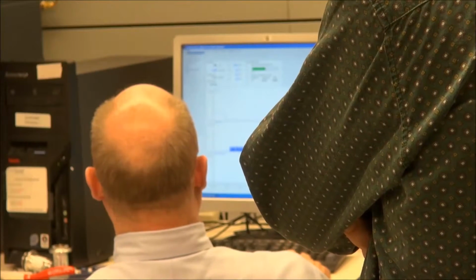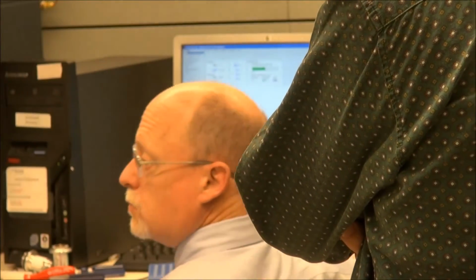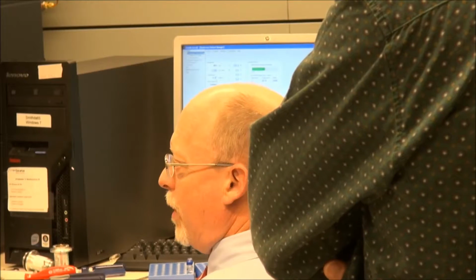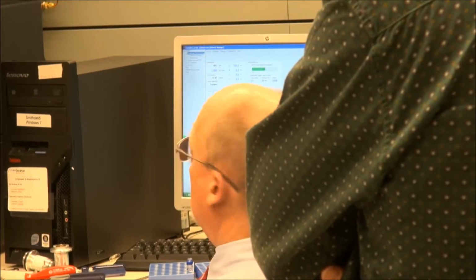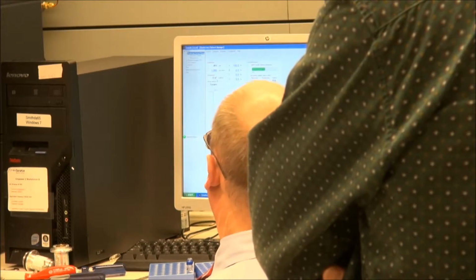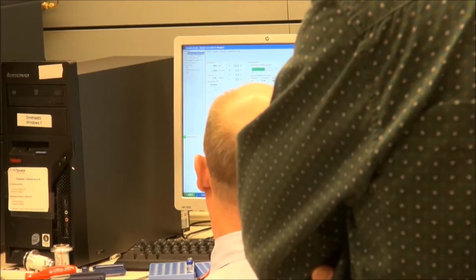So my degasser's at 0.86. It's reasonable. I expect my degasser to be around 0.4. If it goes above 1.0 for 3 minutes, it'll probably error. Is that because there's so much air in there now? 0.87? No. It's just doing the best it can.